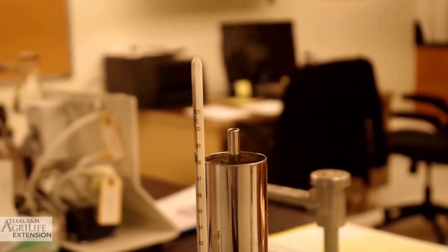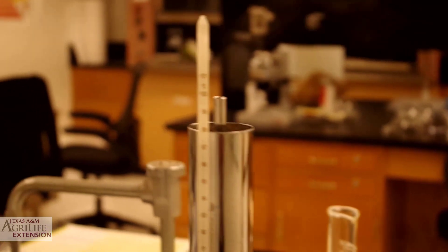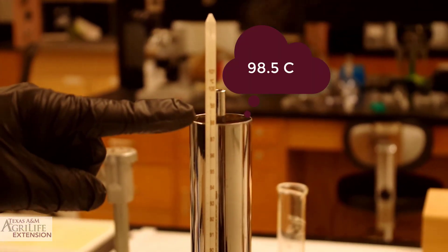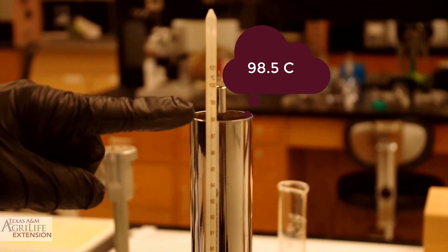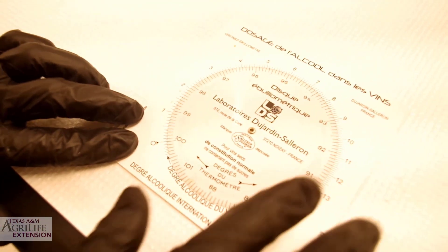The water will soon start boiling and the temperature will start rising in your thermometer. Once the temperature is stable for 30 seconds, you are ready to record it and set your dial. In our case, the temperature is 98.5 degrees Celsius.